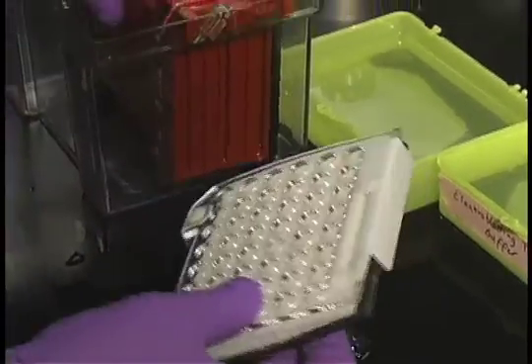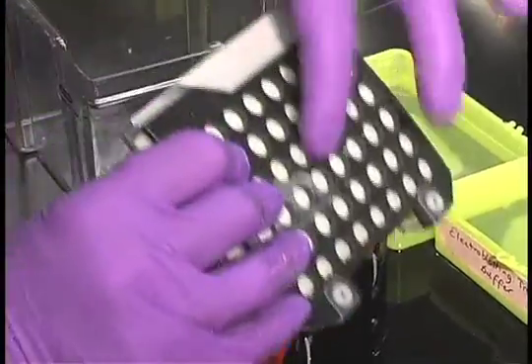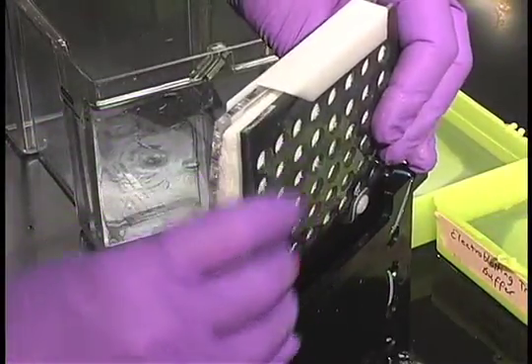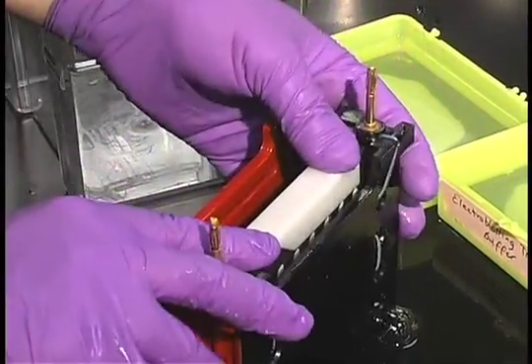We're now ready to put this into the electrophoresis cartridge. The black side goes towards the black side on the cartridge. And the two of these will fit into place.